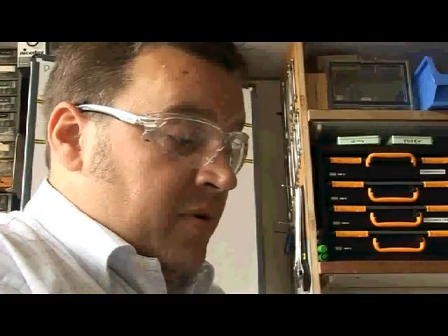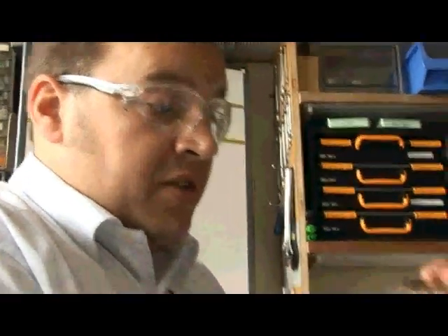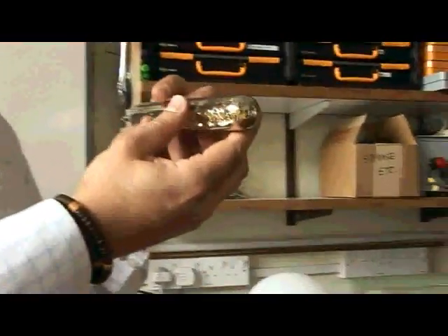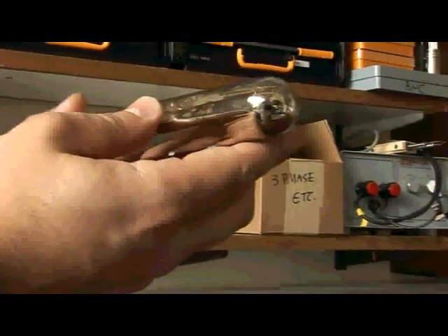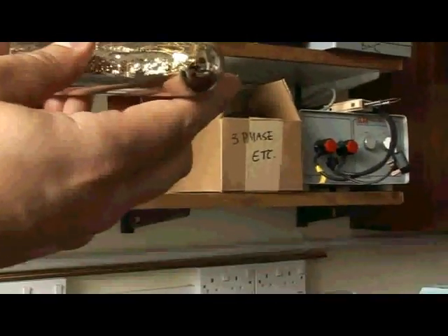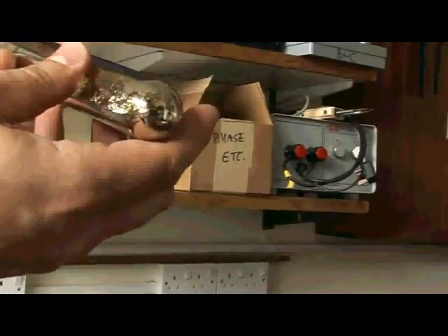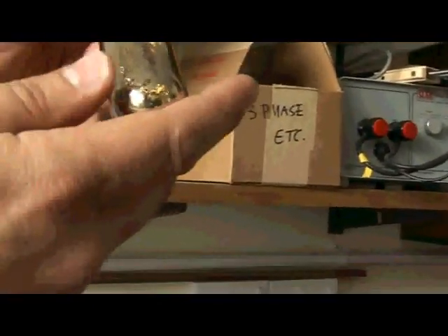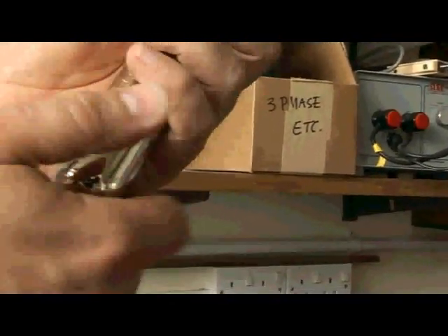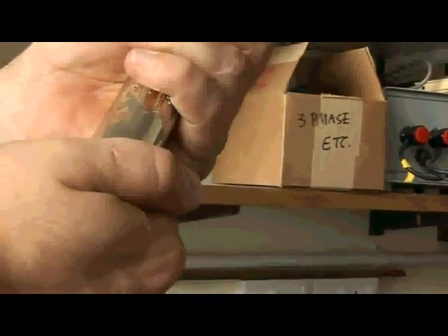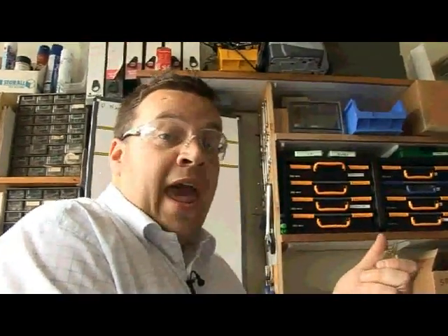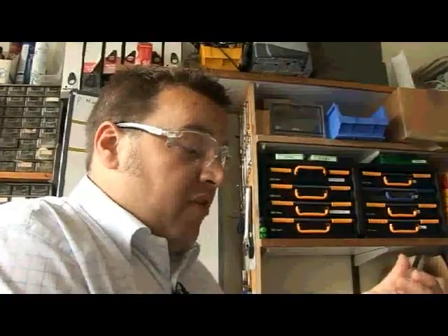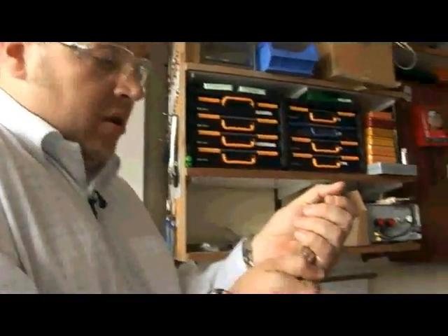So you know that the cesium itself has already started to melt. So you can see that the liquid and it's starting to become mobile within the glass itself. Now we have to be very, very careful when we're handling this because if we break the glass, it reacts very, very vigorously with water. So the perspiration, the sweat on my hands is enough to make this really quite an exothermic and a very, very dangerous chemical to work with.